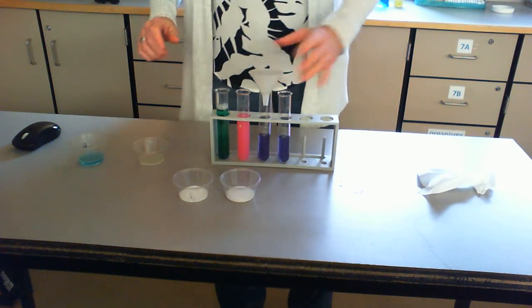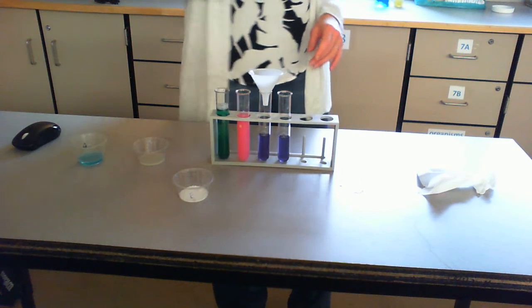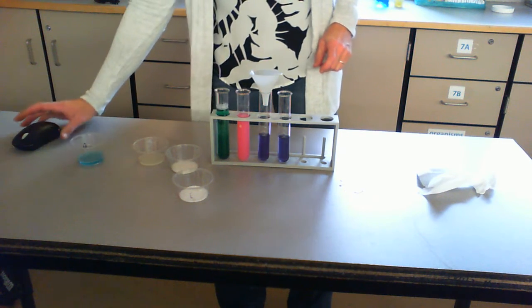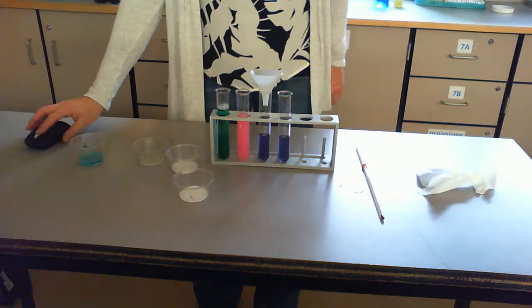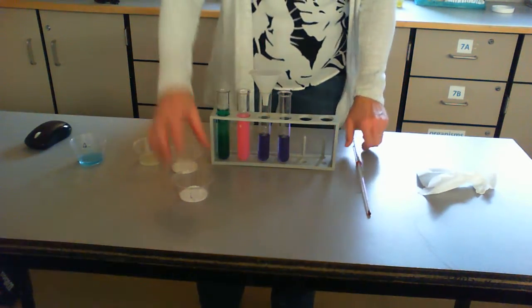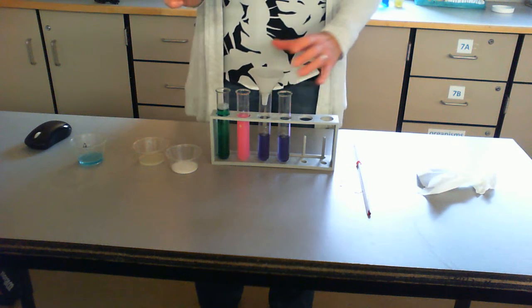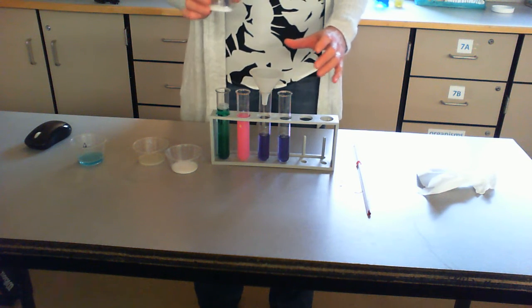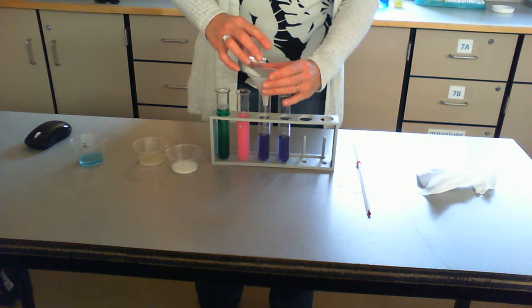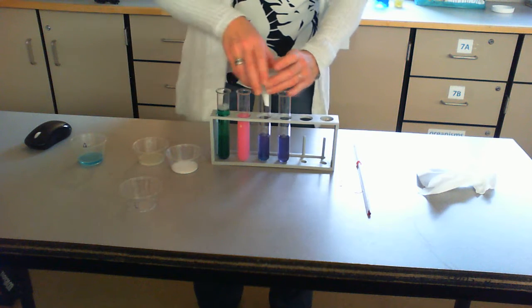So now we have citric acid — we're going to do citric acid next. I'm going to pause the video real quick because I need to get something to stir it with. Okay, I got a long thermometer so that I can stir. Actually, sorry, this is the sodium carbonate. So now we're going to do the sodium carbonate — put the powder in there and get it to go through.